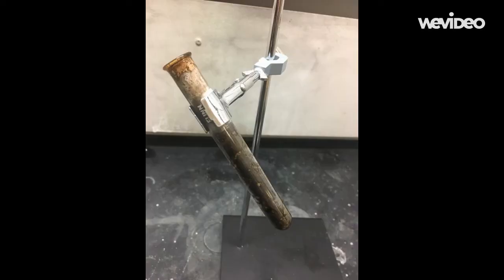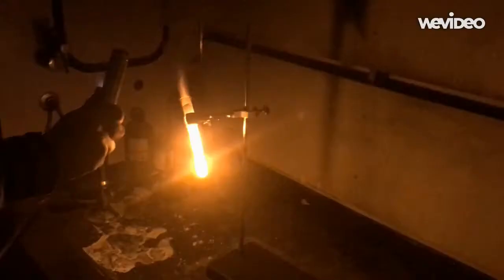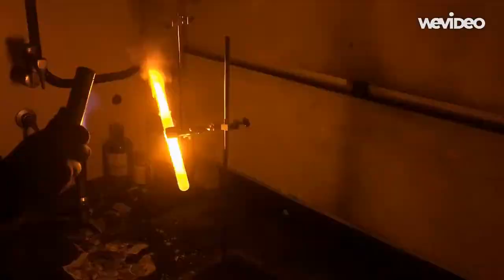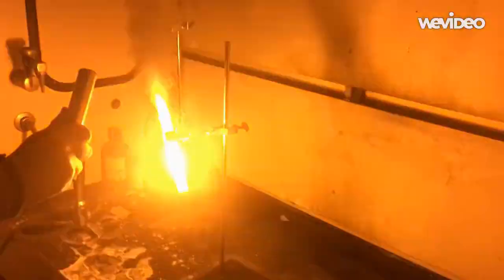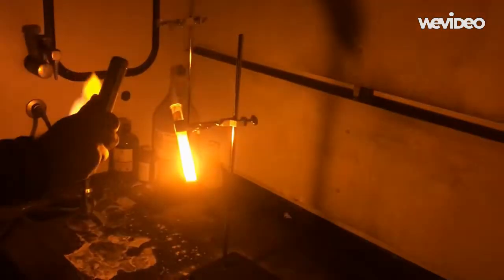The next demo is identical, except for the fact that we are using sodium chlorate instead of potassium chlorate. We do not condone the actions taken by Samuel Tannen or his hand, and we are not responsible for any harm that may have come to Samuel Tannen or his hand during this demo. The light emitted in this demo is yellow because sodium burns a yellow color.